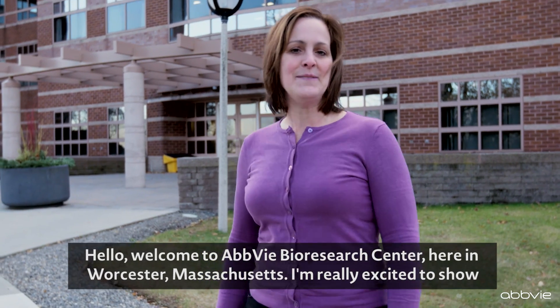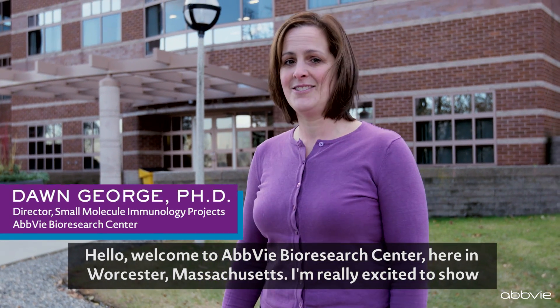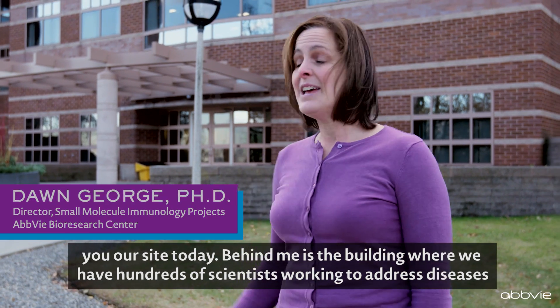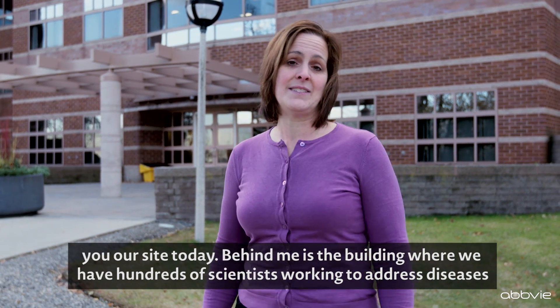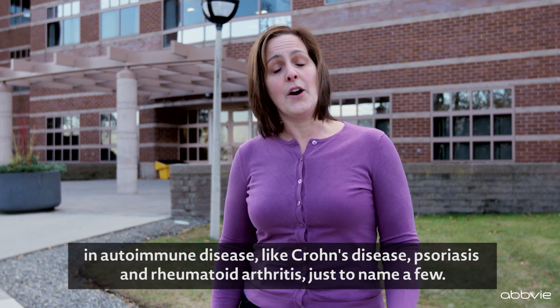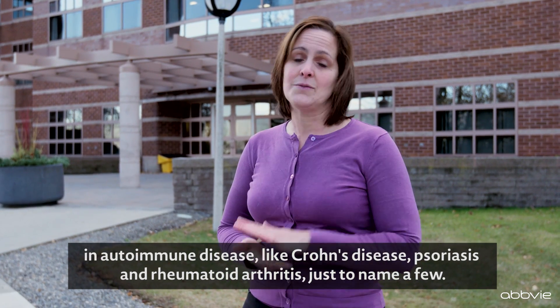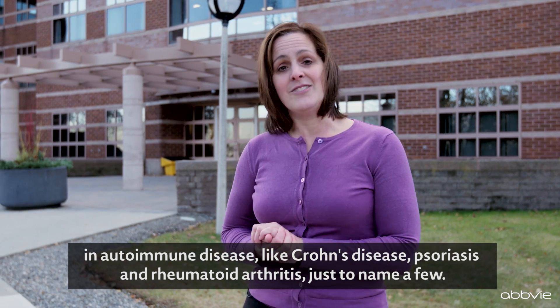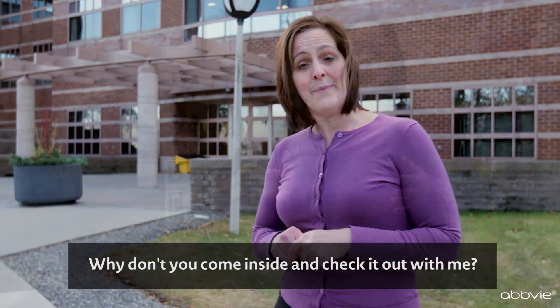Hello, welcome to AbbVie BioResearch Center here in Worcester, Massachusetts. I'm really excited to show you our site today. Behind me is the building where we have hundreds of scientists working to address diseases in autoimmune disease like Crohn's disease, psoriasis, and rheumatoid arthritis, just to name a few. Why don't you come inside and check it out with me?